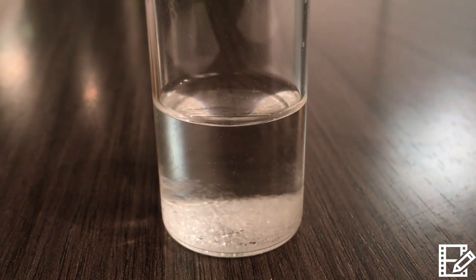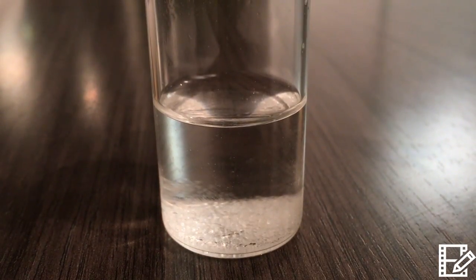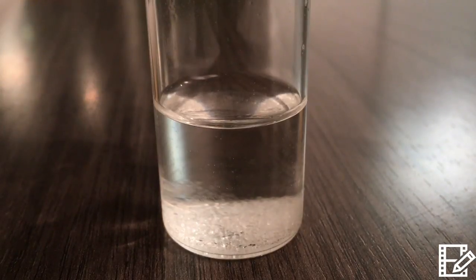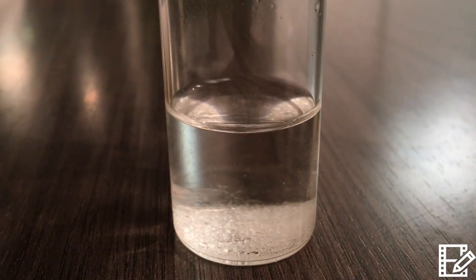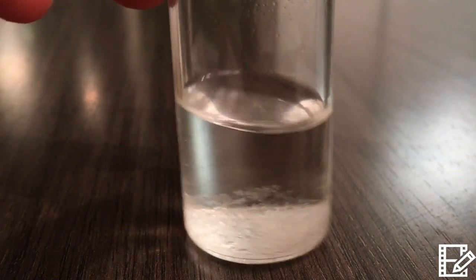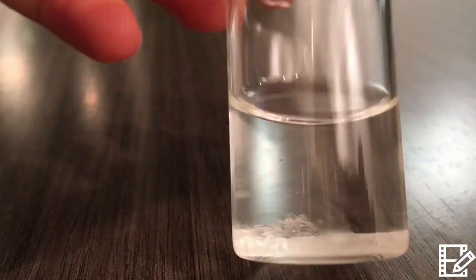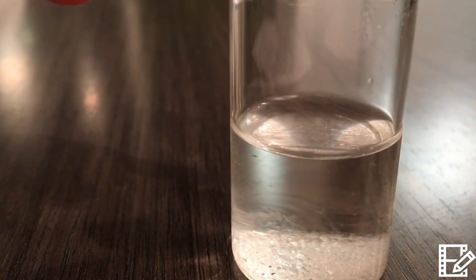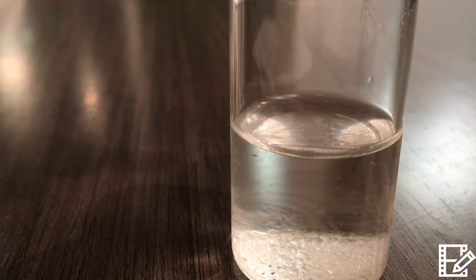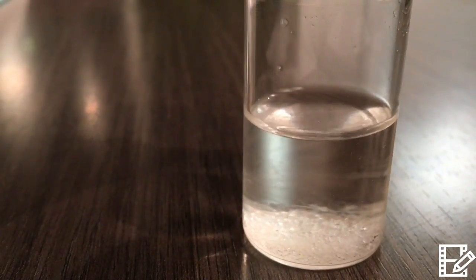As you can see, there have been many changes to my alum crystals since my last video. In the last video, the only thing visible in my vial was a fuzzy looking blob floating in the middle. Now, actual crystals are visible on the bottom and on the sides. The crystals are clear and fairly large, and there are too many of them to count individually. They are shaped like little round crystal rocks.